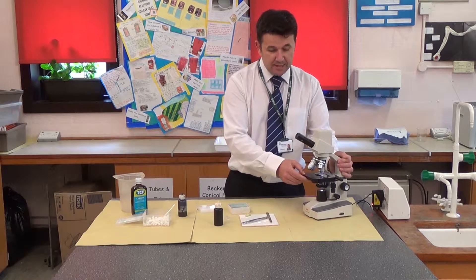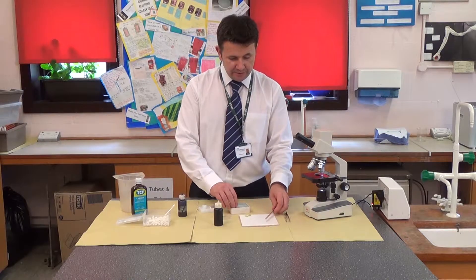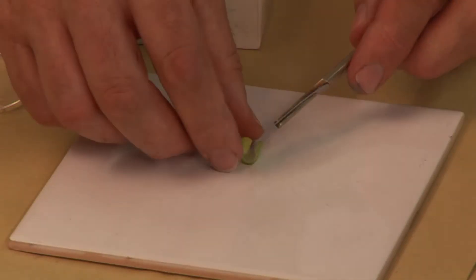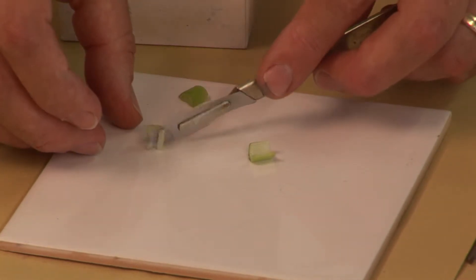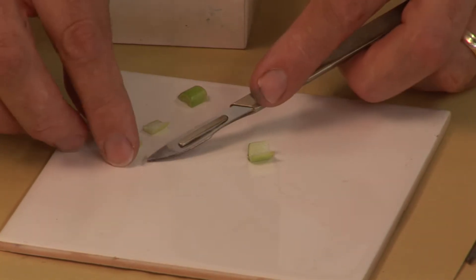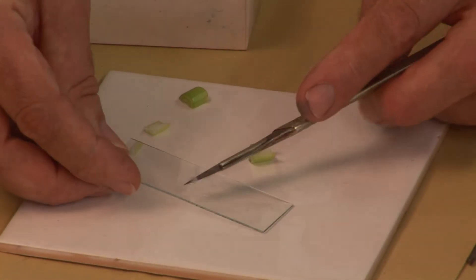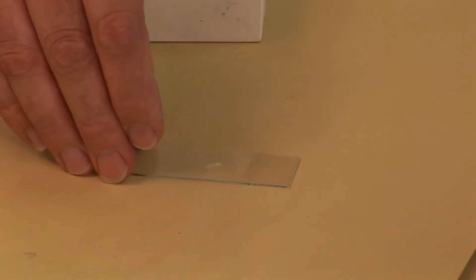What I'm going to do now is prepare an onion slide. First of all you need a piece of onion. I'm going to peel it very carefully — actually I'm going to just cut it to make it quite thin, so I'm going to make a thin sample. Then I'm going to place it on a glass slide, just place it flat on the glass slide, like so.